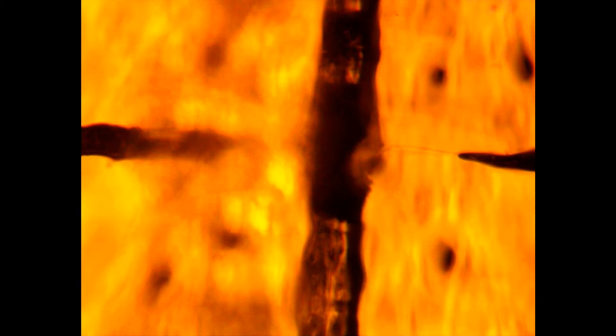If you want to see why, looking at the microscope you can see that the north branch is just too narrow to make a good fluidic connection. But it's still a significant improvement over what we were getting before, where maybe two of the four branches even existed after sealing.